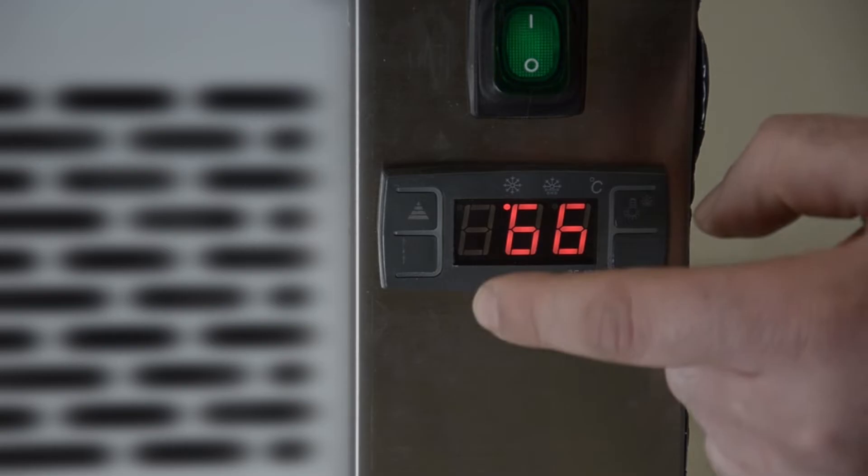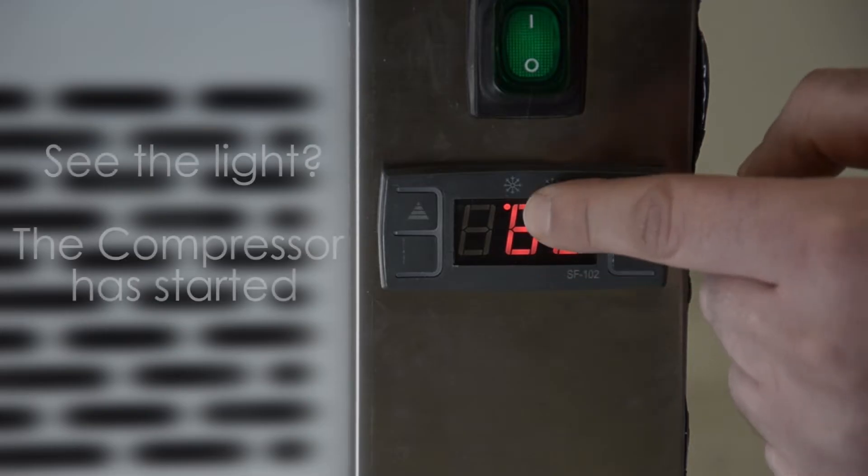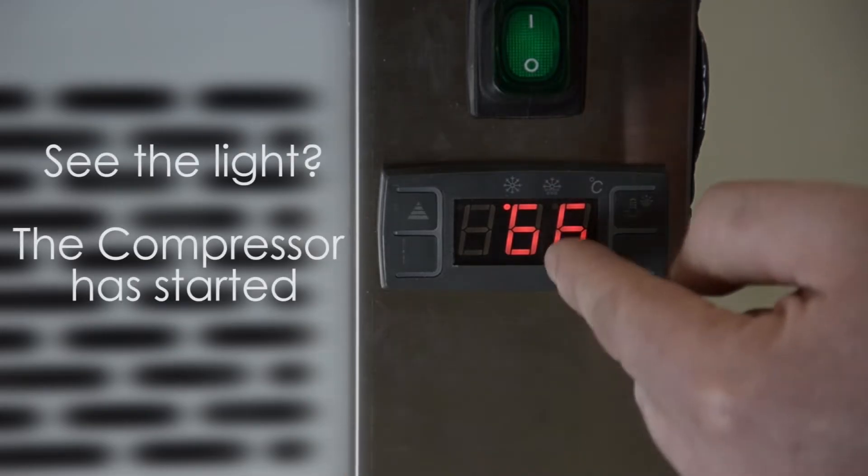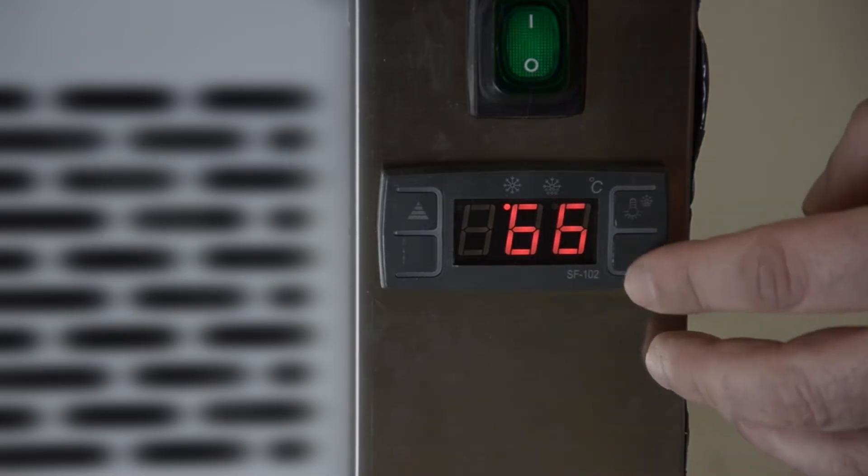Now it's permanently red, compressor started and now the cooling started and it will drop the temperature to the temperature that you have set for.